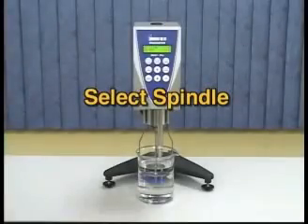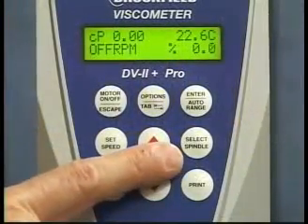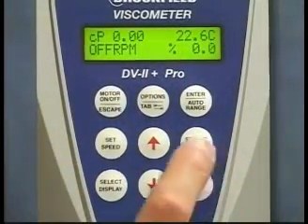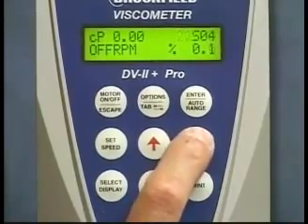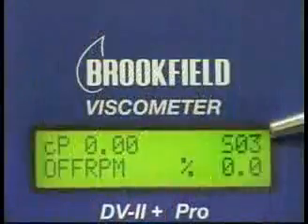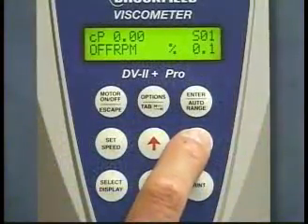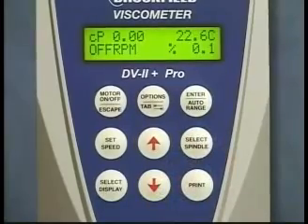Select spindle. The select spindle key initiates spindle selection when first pressed. Use the arrow keys to scroll to the spindle you wish to choose. A second press of the select spindle key then enters your spindle selection.